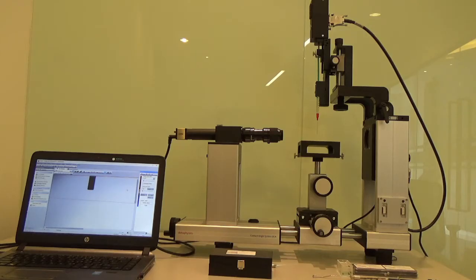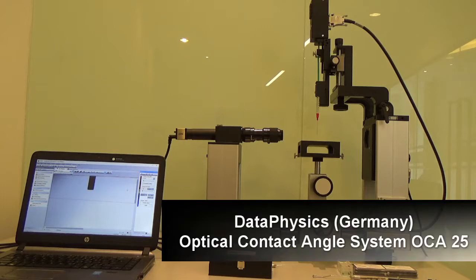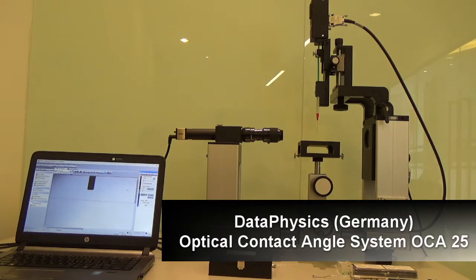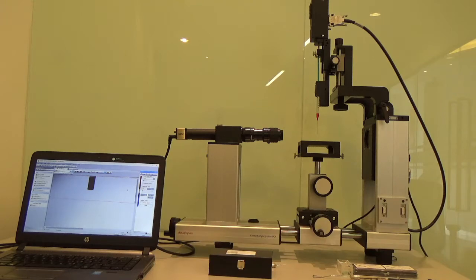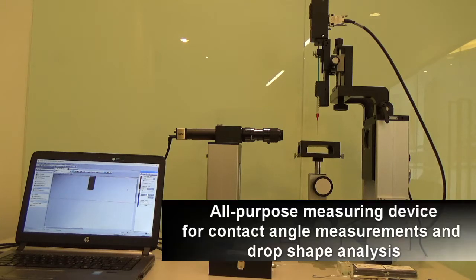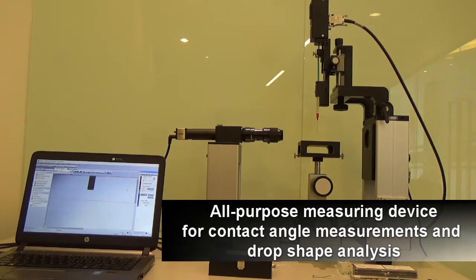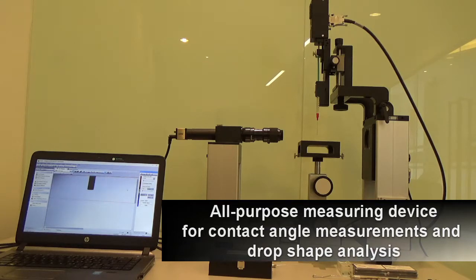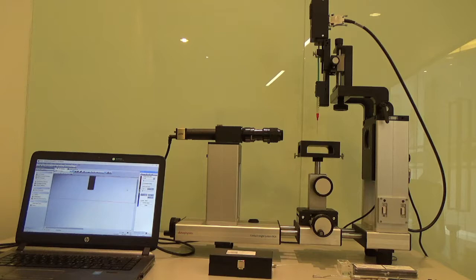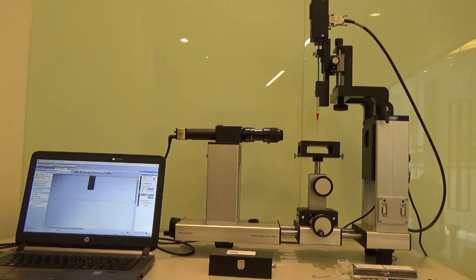Good afternoon everyone. Today we have this model from Data Physics, the OCA25, which is an optical contact angle system. This system is able to measure contact angle, surface tension, surface free energy, as well as interfacial tension.